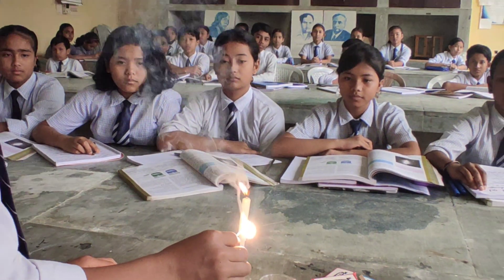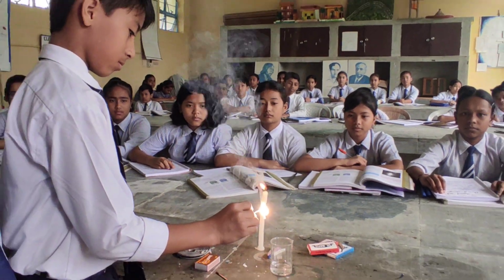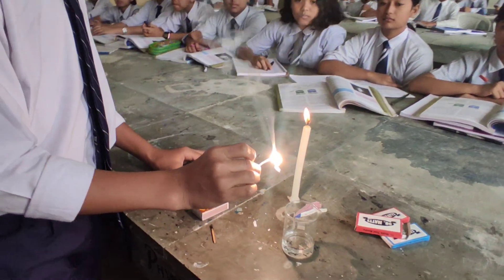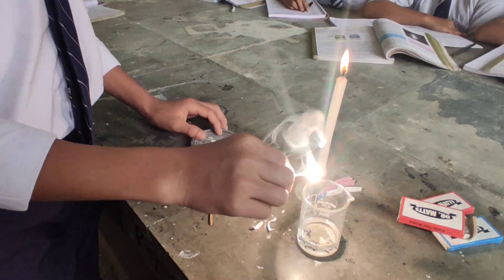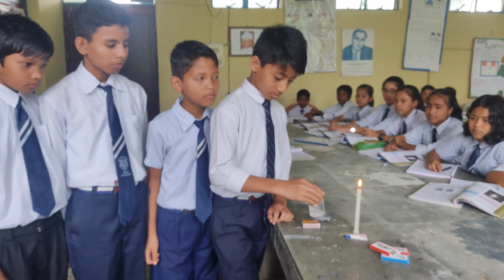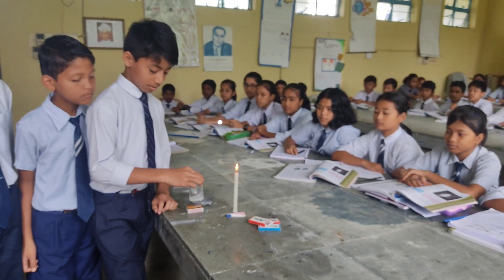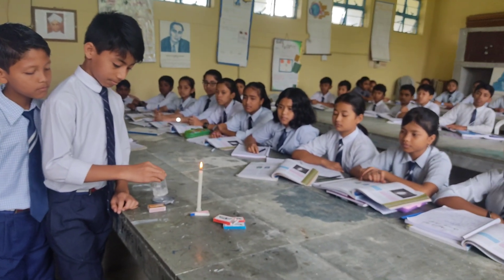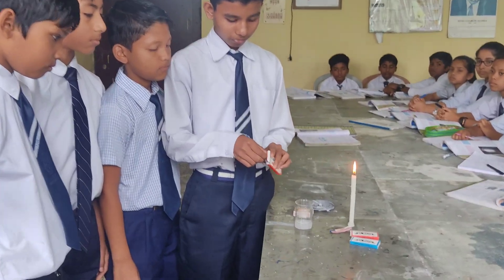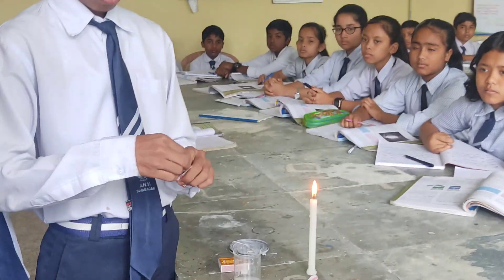The white powder so formed is magnesium oxide, which is put into water taken in a beaker. Magnesium oxide reacts with water to form magnesium hydroxide, which is basic in nature.